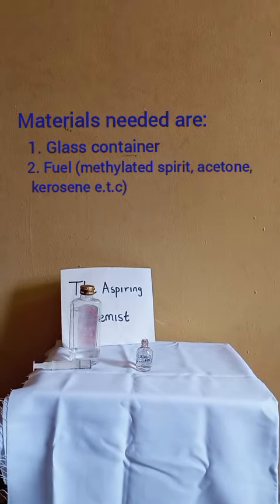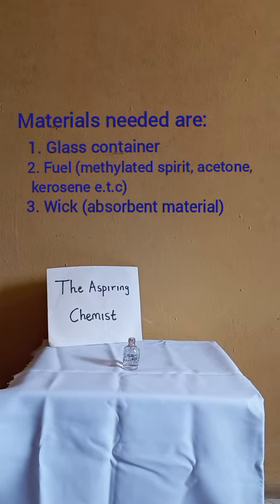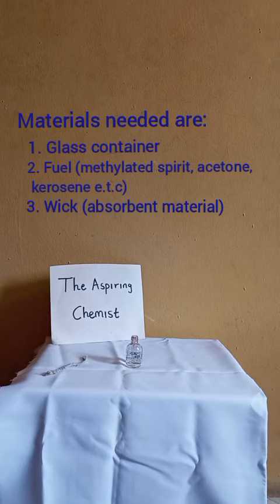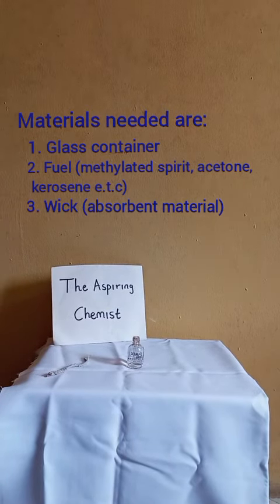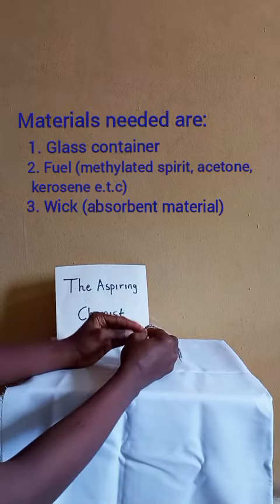Next, you need a wick. And for the wick, I'm going to be using this rope. You can also use cotton wool or anything, as long as it's an absorbent material. So now I'll put the wick into the container.